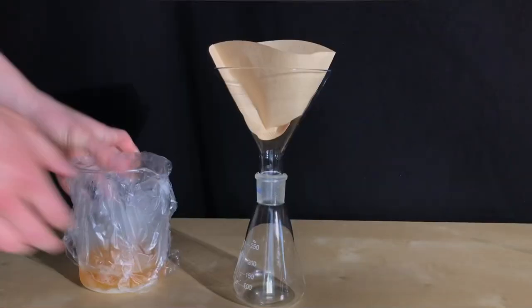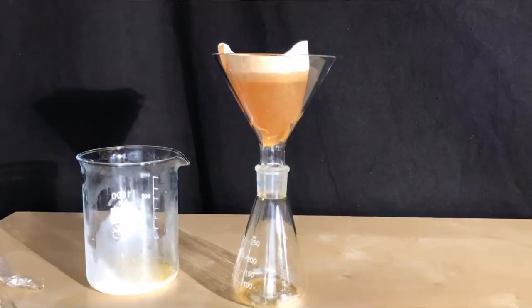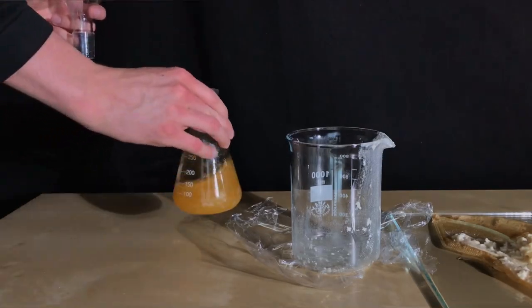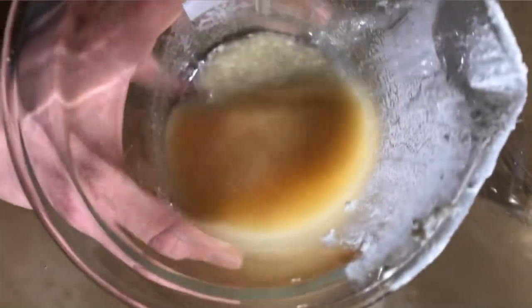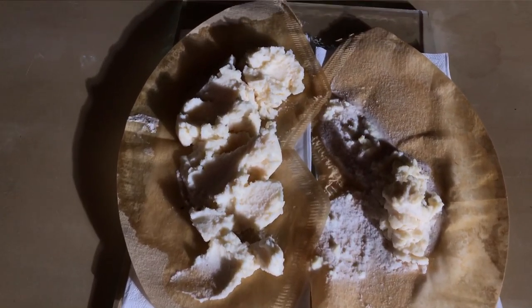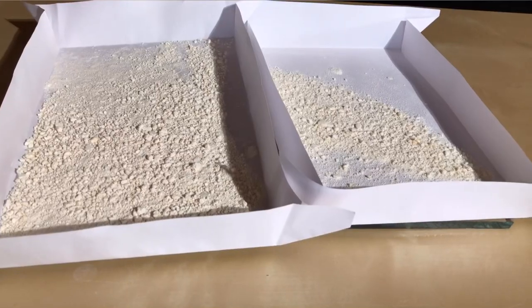The hot plate was switched off and the beaker was placed in the freezer. The next day, a gravity filtration was performed. For some strange reason, most of the acetylsalicylic acid crashed out after the gravity filtration, so I decided to do a second one. The material that crashed out after the first filtration was filtered again and labeled as dirty acetylsalicylic acid. After the filtration, we were left with two portions: on the right the clean acetylsalicylic acid, and on the left the dirty stuff.